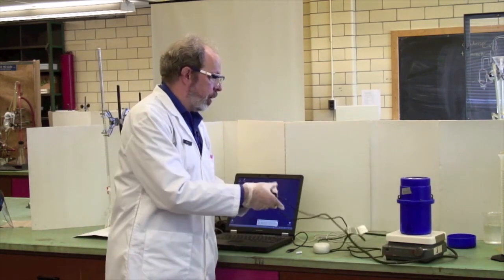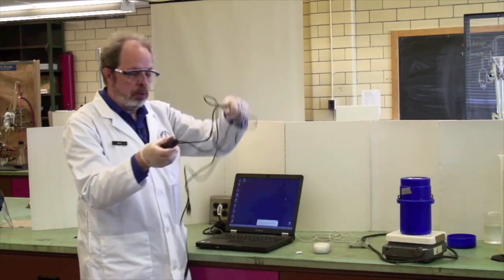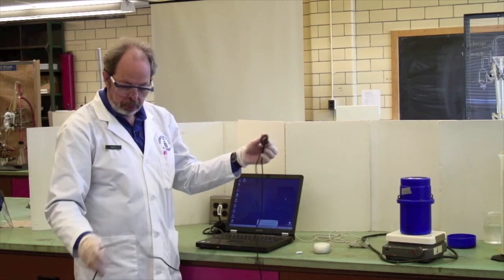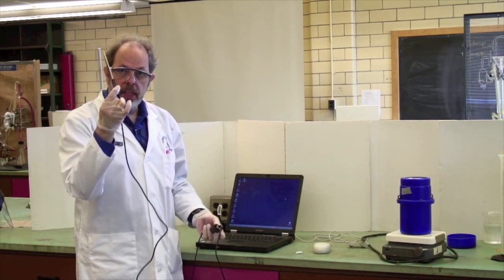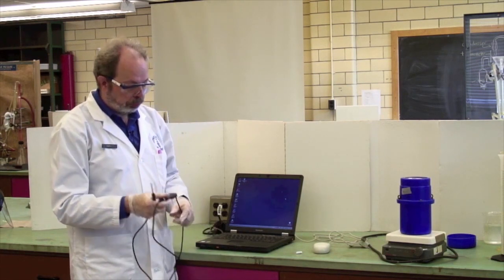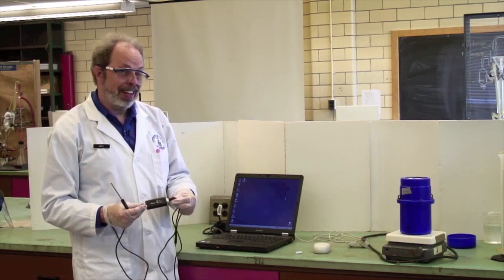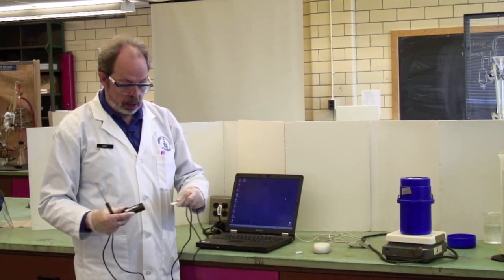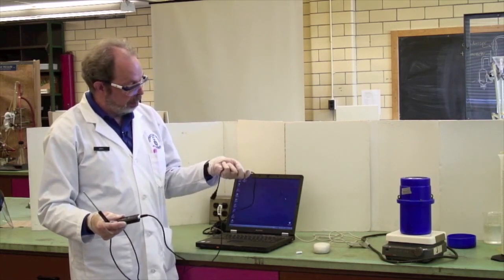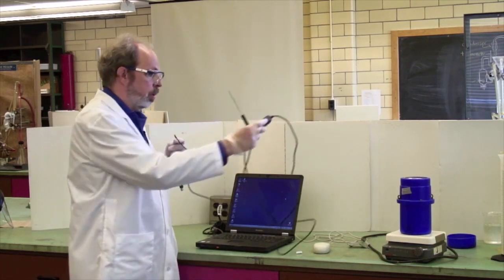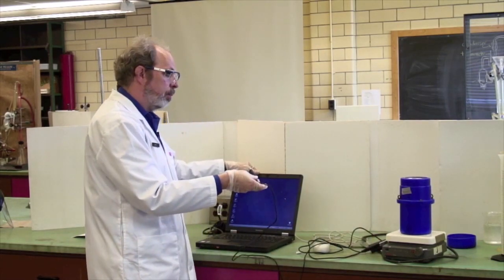You will recognize a mouse but you won't recognize this particular hardware. This is a thermocouple which will be placed inside the calorimeter and it goes through this box which is technically called a Go-Link, which disconnects there, and we have here a USB port key which actually fits in the back of the laptop.